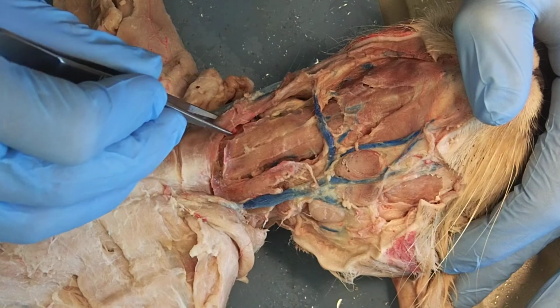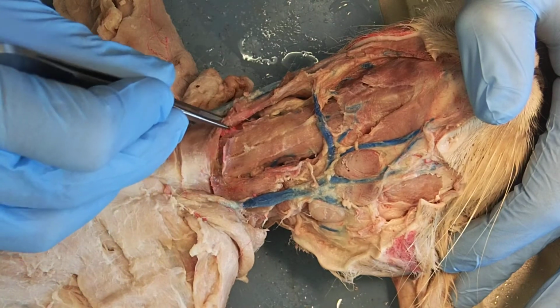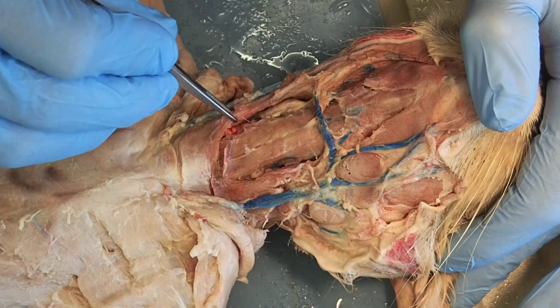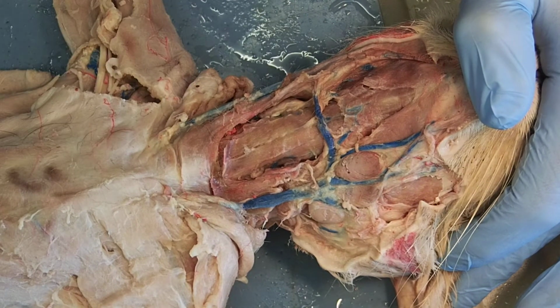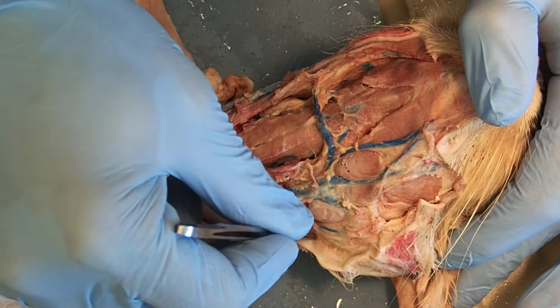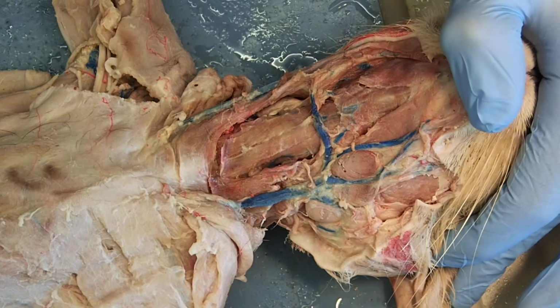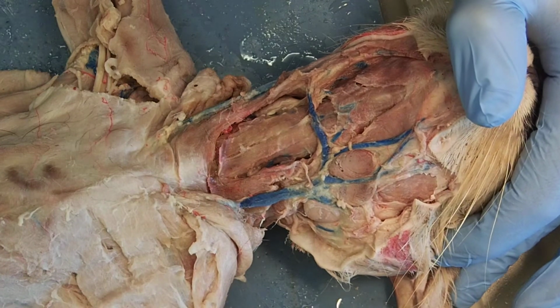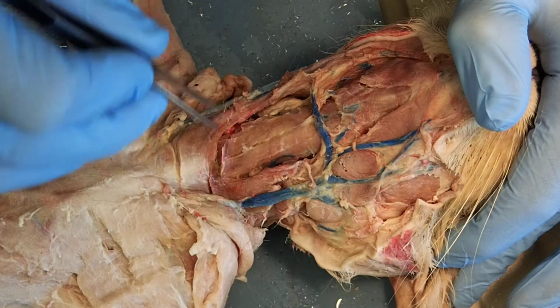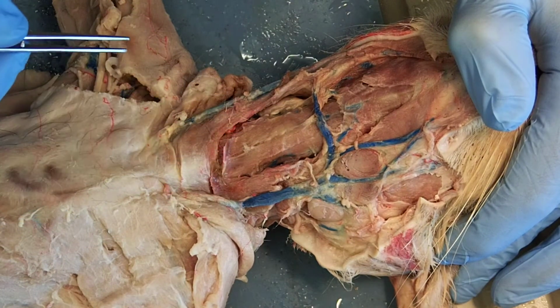Sitting next to that, this muscle, and I started pushing this one off to the side already a little, these muscles that are basically bookends to the throat, this is going to be my sternomastoid muscle. Sternomastoid. It's going from the sternum up to the mastoid process that's on the posterior side of the head. I'm going to show you the homologous structure for humans in just a little bit. In humans, it would be the sternocleidomastoid, but it's the same muscle as the sternomastoid here. So these are my bookends to the throat region.